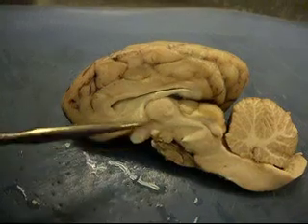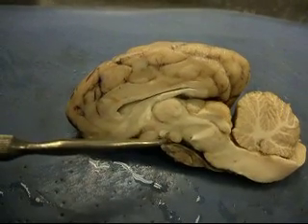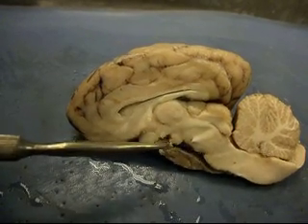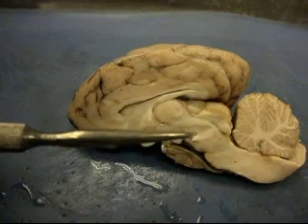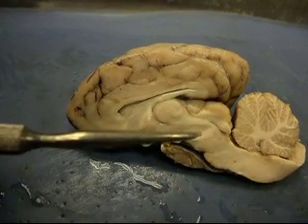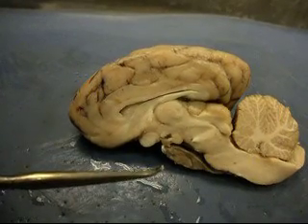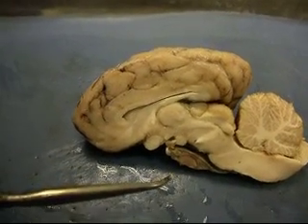We've got a mammillary body in here somewhere. The mammillary body is right there in the middle — it's the one that's connected.